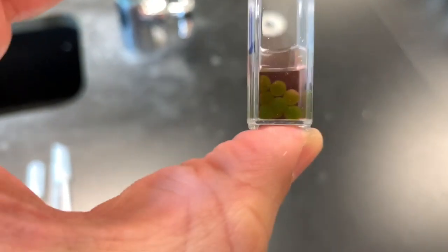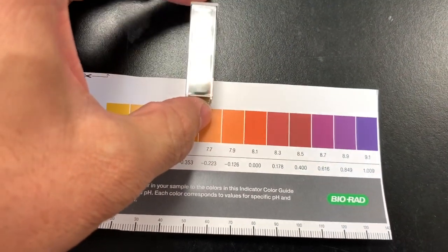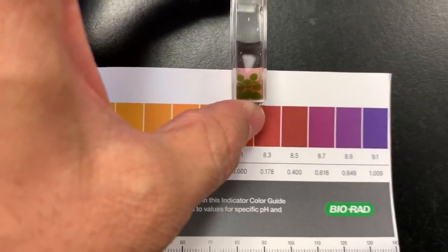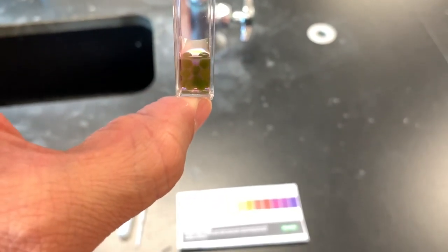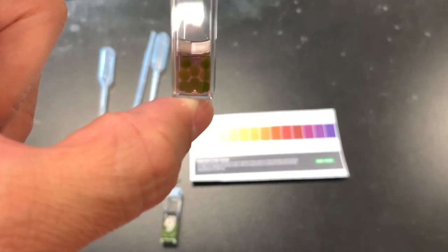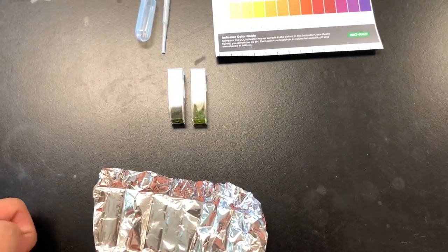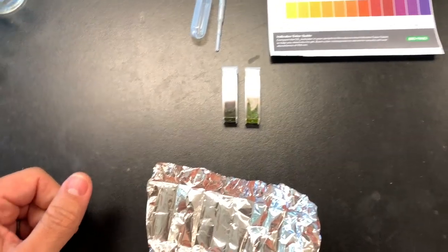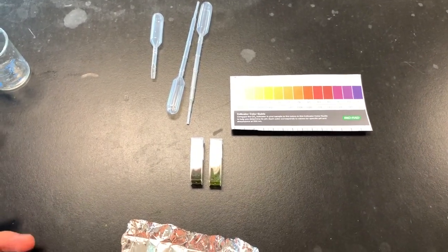A little bluish purplish almost. A drastic change to that if we put it up here. It's very dark. Yours will not change this quickly because I did mine much quicker on over time than yours. Yours won't change as fast, but mine went from 7.1 to looks like maybe like an 8.3 ish on there. But you're just going to keep recording the pH change for five minutes. Every five minutes, for 45 minutes, and then you're going to graph the data and answer the questions. So that's the Algae Bead Lab.